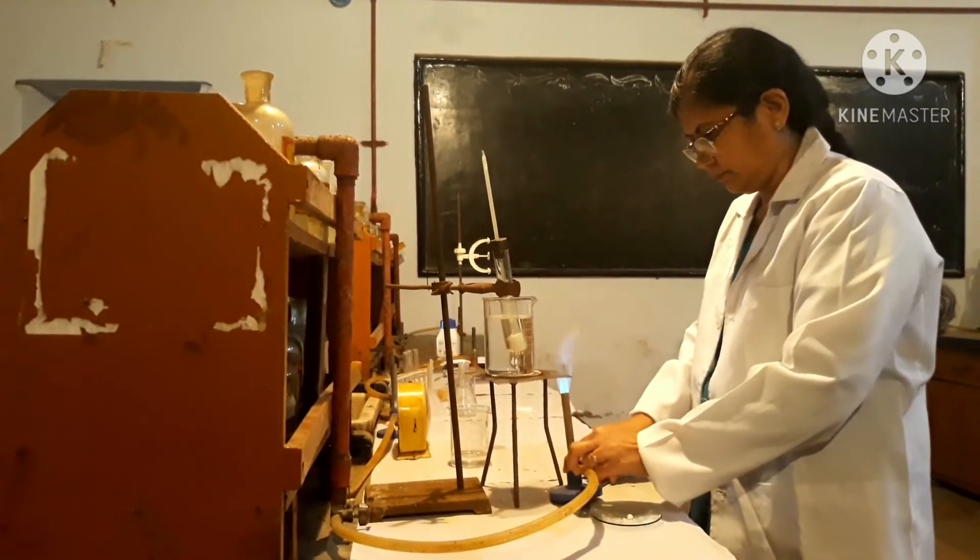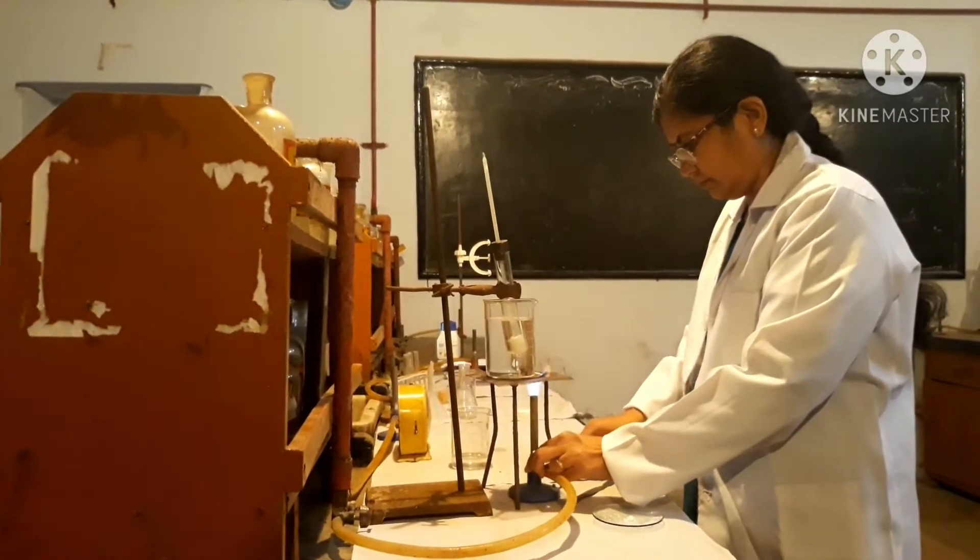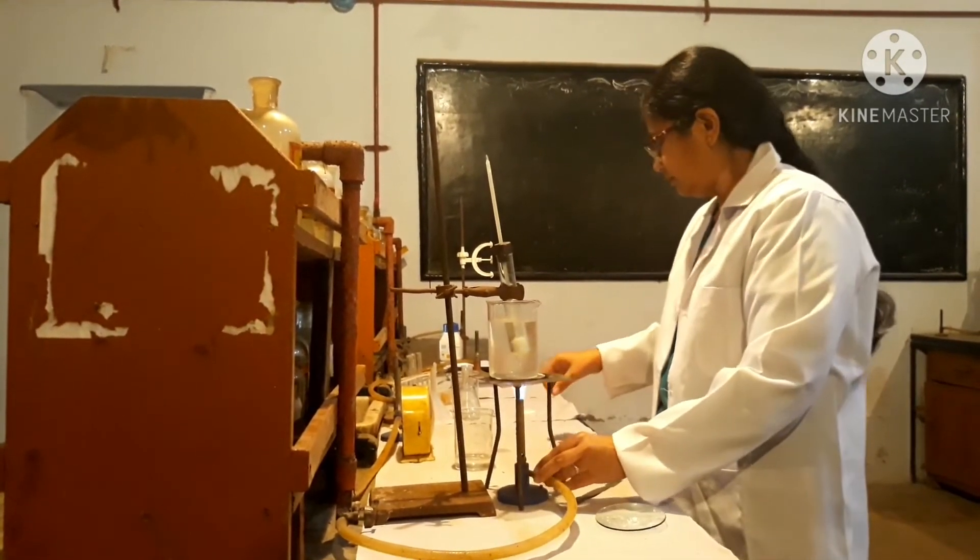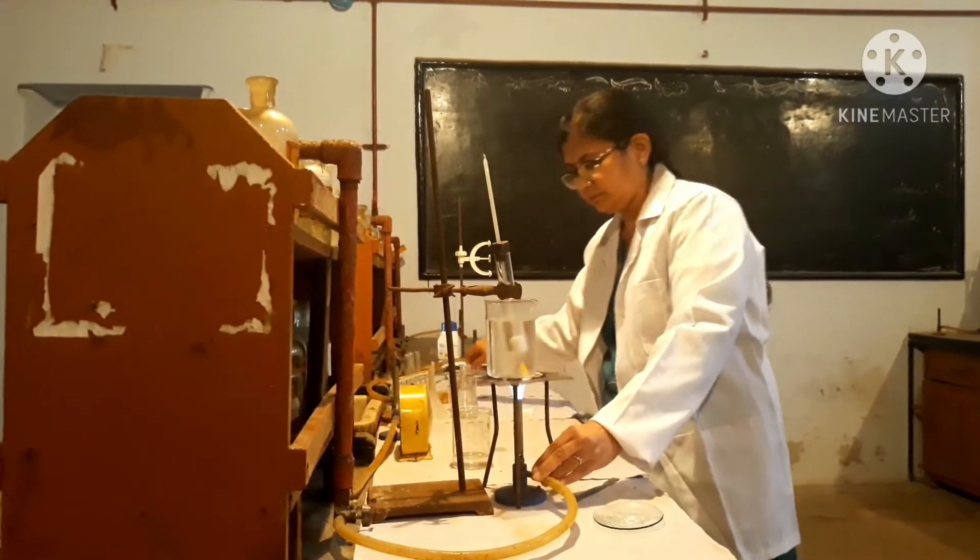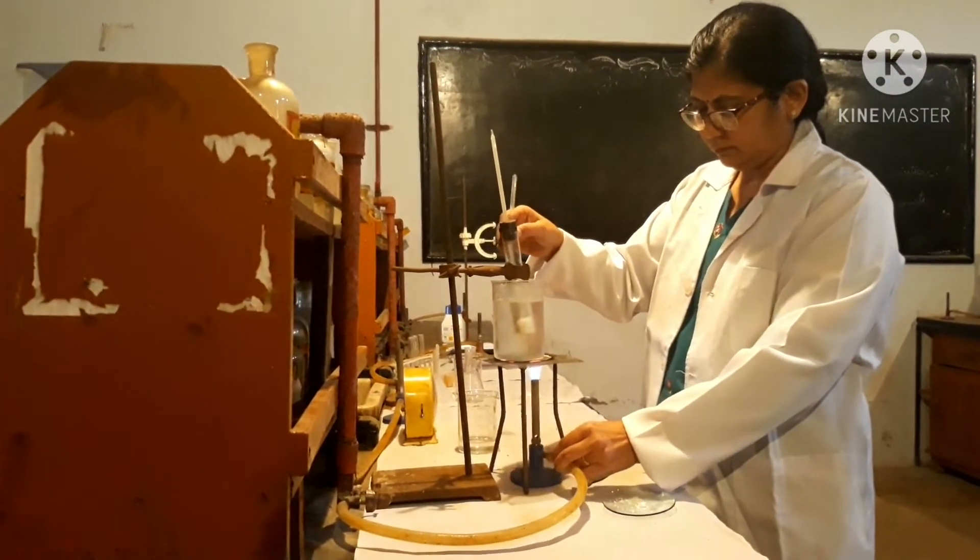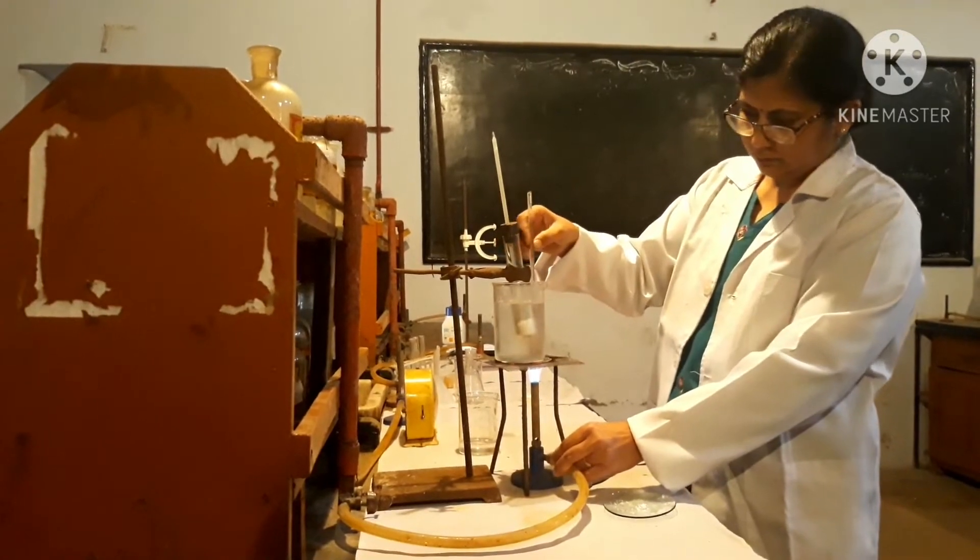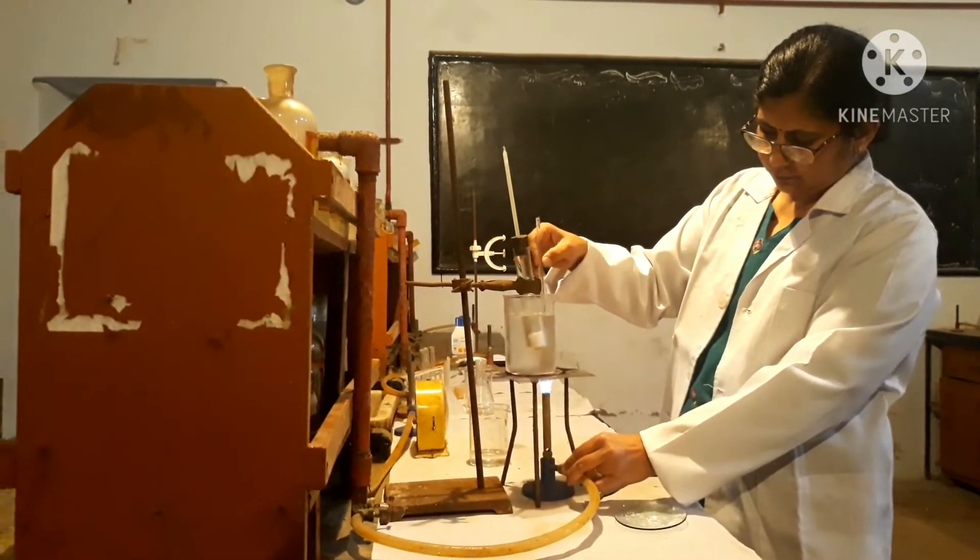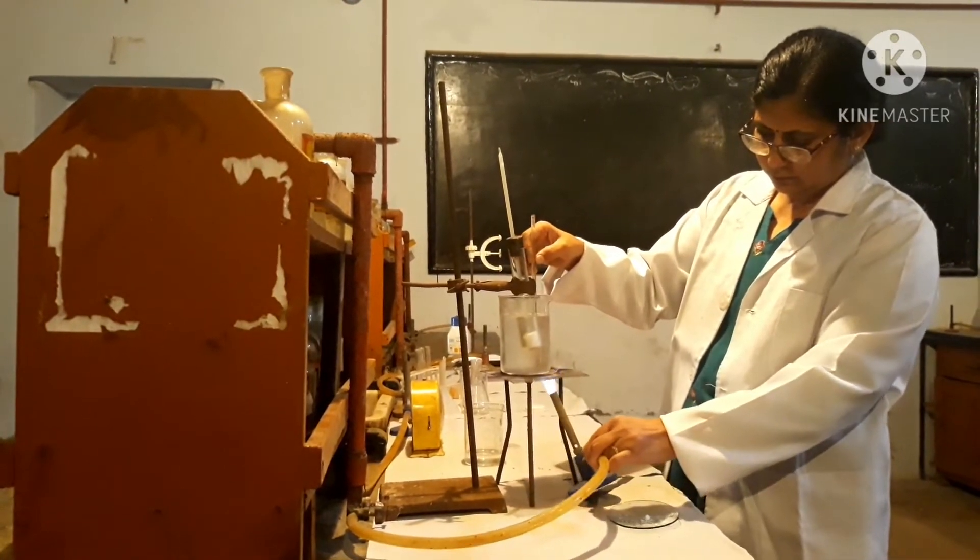Now heat the beaker gently stirring the water regularly. We can stir the water by a glass rod for uniform heating.